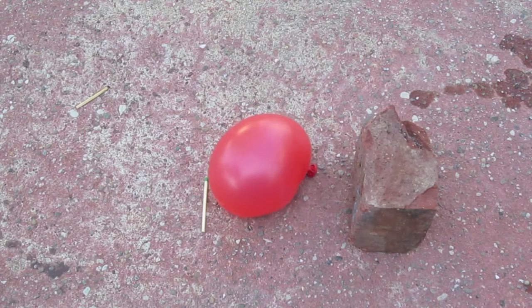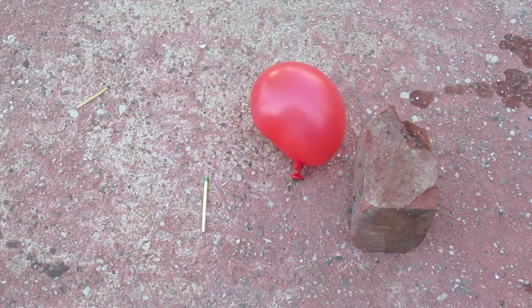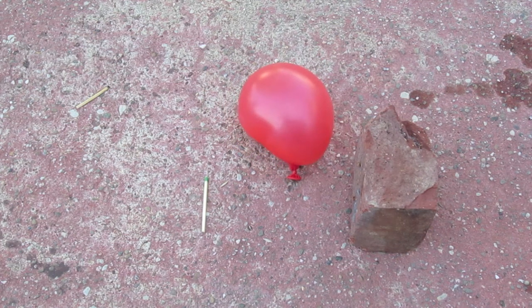Many times when I was igniting the hydrogen balloons that I made, I felt heat from the explosion, but it could be that the explosion is so fast that it can't be caught on camera. But for some reason I can't actually see flame on the camera, except for this one.